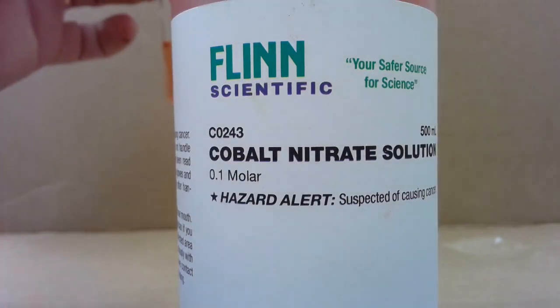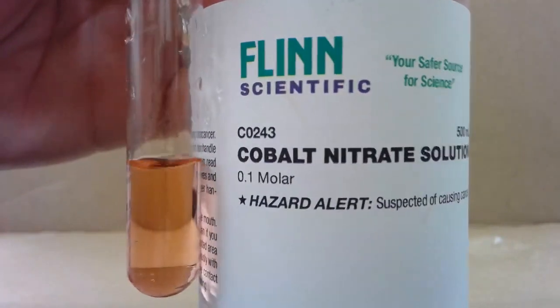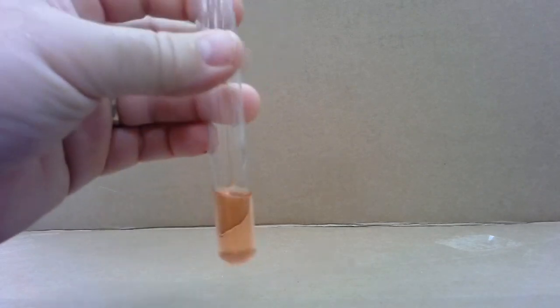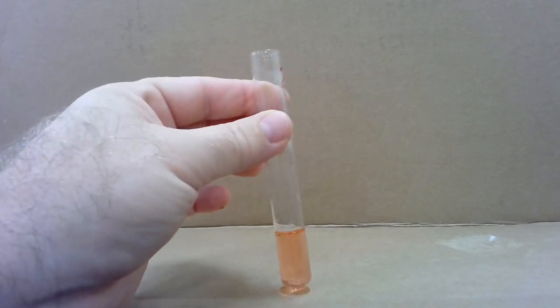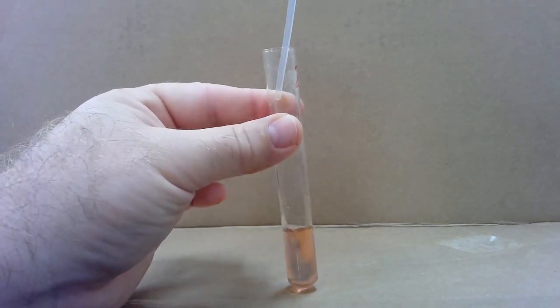Wrong lid. And to that I'm going to add some sodium hydroxide. So I can get some in my dropper. That might be enough. So here's my pink cobalt nitrate solution. And I add some sodium hydroxide to that.